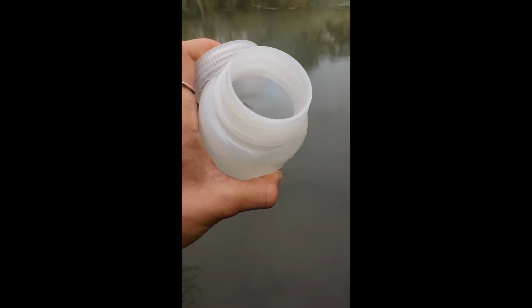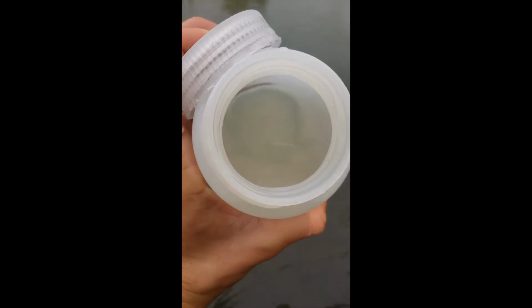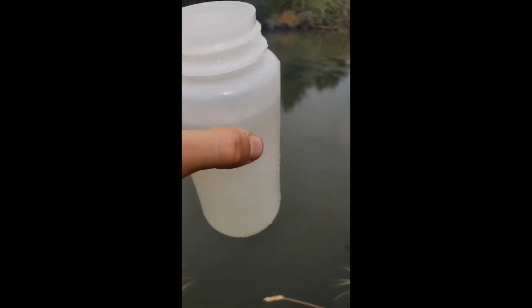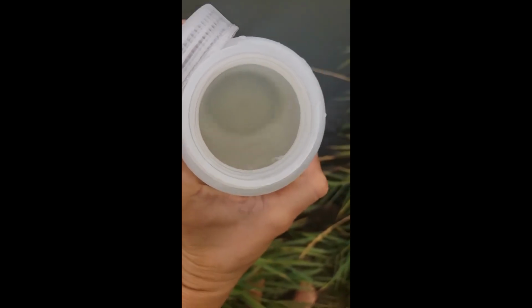Now let's go measure it. First, I want to make some observations. What do you notice? Just like right off the bat. What's true about this water that you see compared to other water? I maybe don't want to drink it.